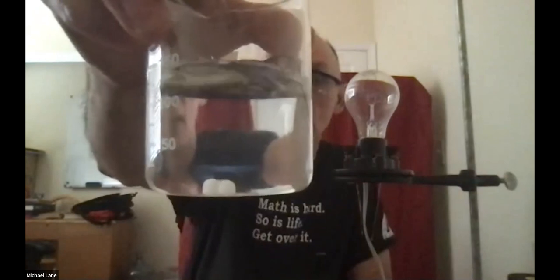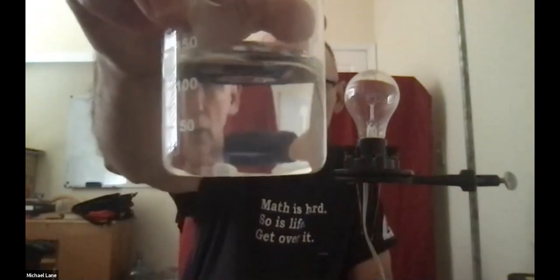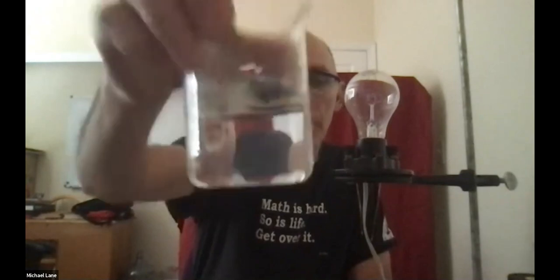Now, the sodium hydroxide, it's hard to tell that it's dissolving. It doesn't show real well in this, but I can see some density currents in there. But this should give me a good idea. No, not much has dissolved yet. There we go. The light bulb is on, so that solution is certainly not saturated, but it's certainly dissolving the sodium hydroxide. So I'm going to stir that around a little bit more. And just for good measure, right, light bulb there, definitely on. Okay.